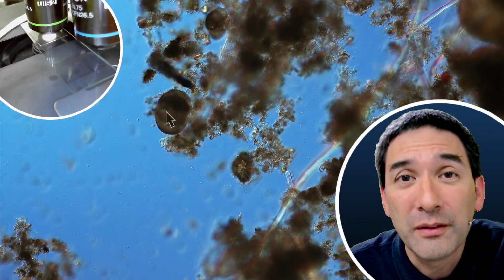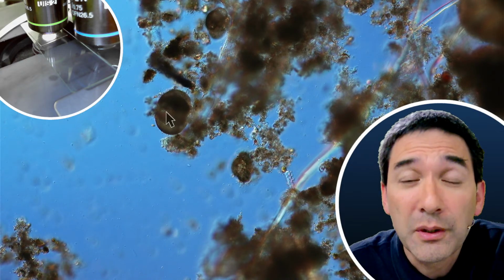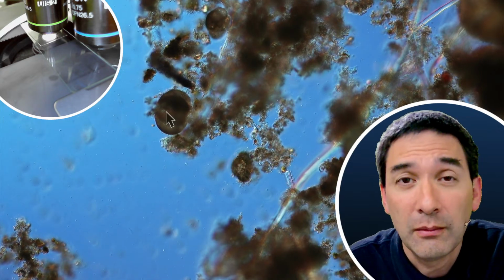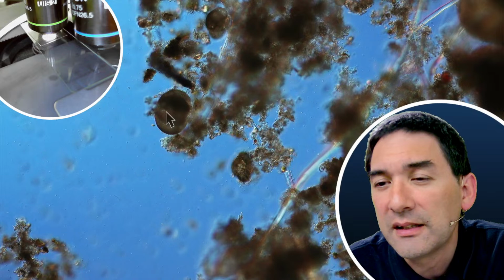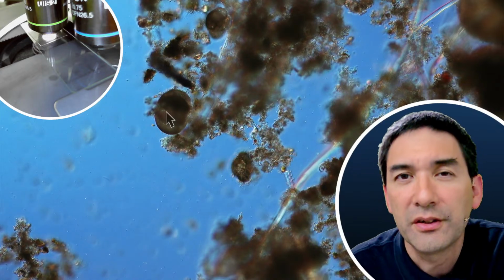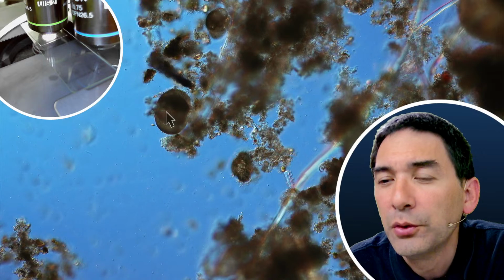I've been much more successful in finding tardigrades and other interesting microscopic animals in moss that has been found in the forest, because I suppose it has not been dry for a very long time. It was always a little bit lush and green, and I think this allows tardigrades and other small animals to survive better. So far, I only have the usual species, Paramecia, rotifers, but no tardigrades so far.